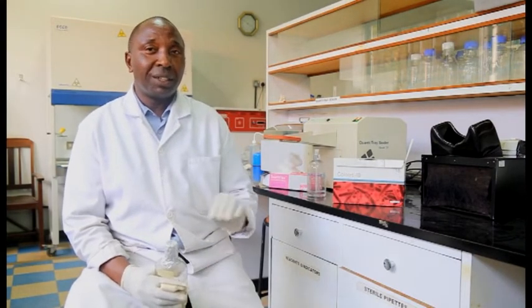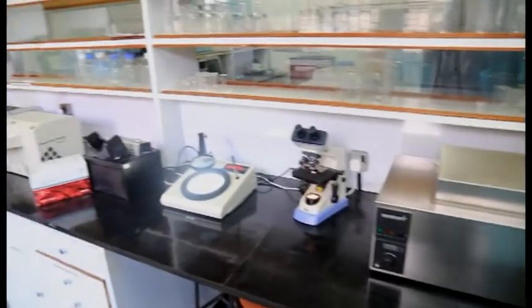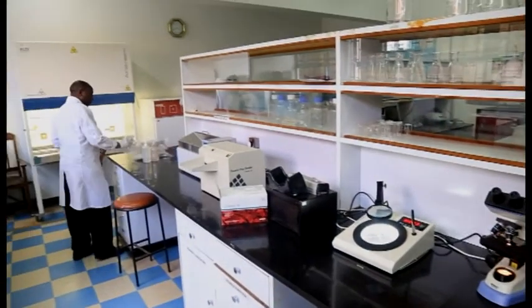So that's why in this lab currently we are not doing fecal coliforms, but we do what is called E. coli. Instead of doing that general thing called fecal coliform, we go direct to E. coli. So any water found to be containing both general coliform and E. coli is unfit for human consumption until that water is treated by disinfection using maybe chlorine or other means like ultraviolet rays.